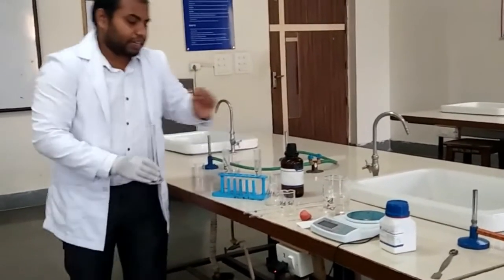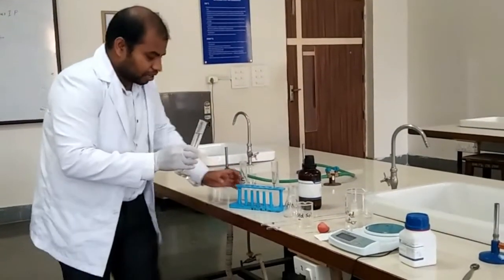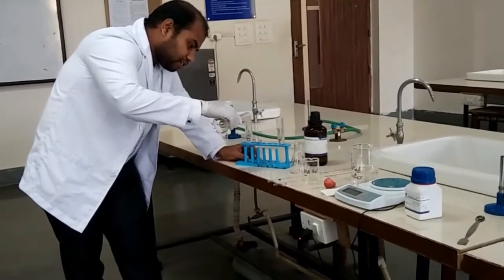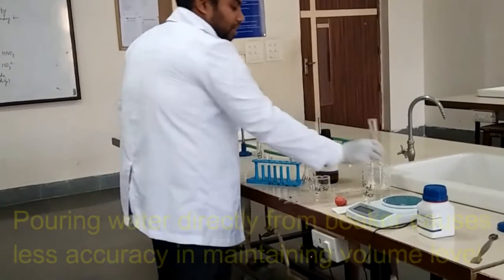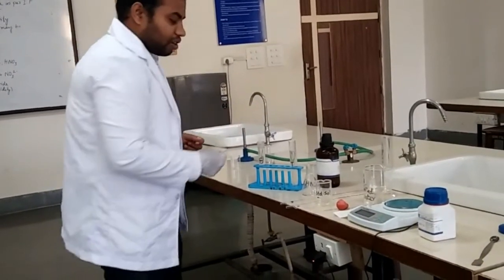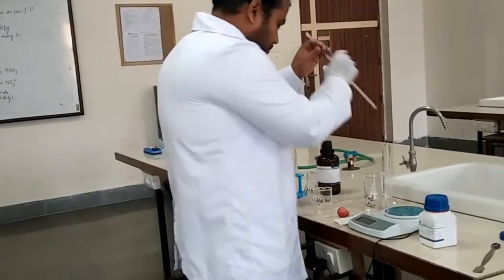We make up to the 50 mL mark for both the standard and test cylinders using a measuring cylinder to maintain accuracy. Using a measuring cylinder rather than pouring directly from a larger container reduces the chances of error and ensures good laboratory results.